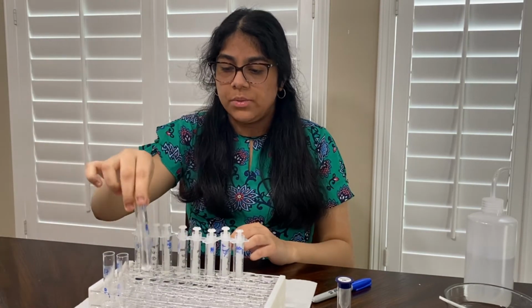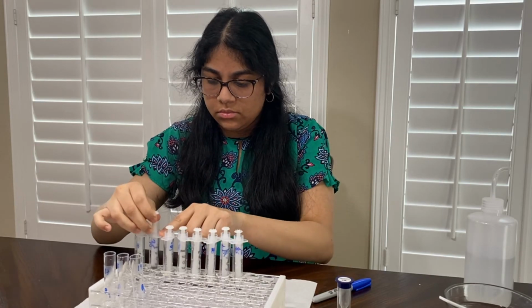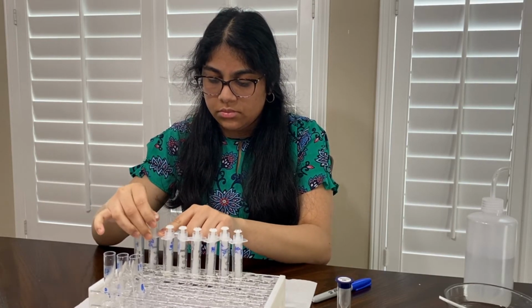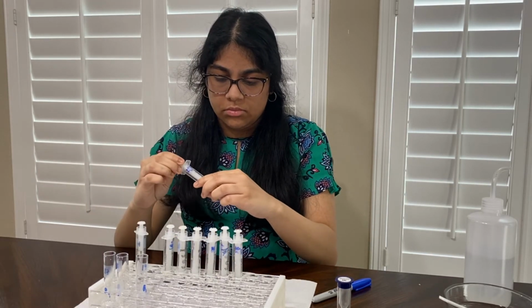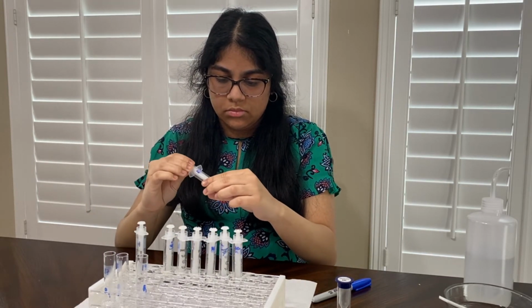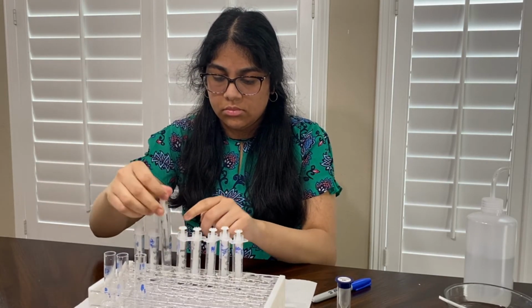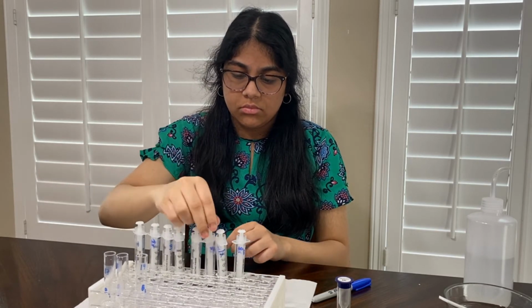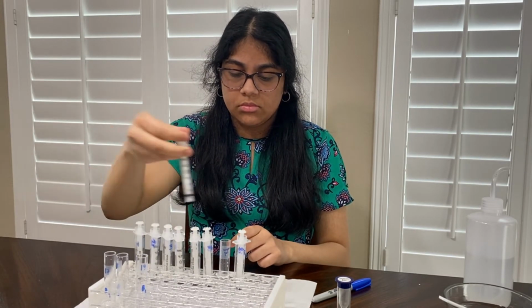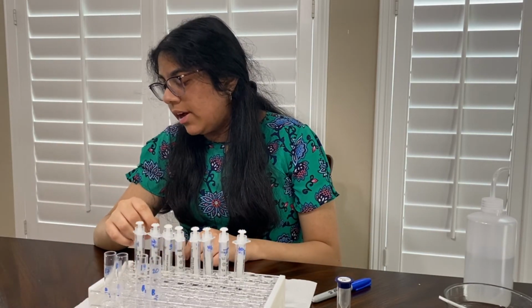And then my third pool test, which is going to have samples 2, 3, 6, and 7. And then my fourth pool test is going to have samples 1, 3, 5, and 7.